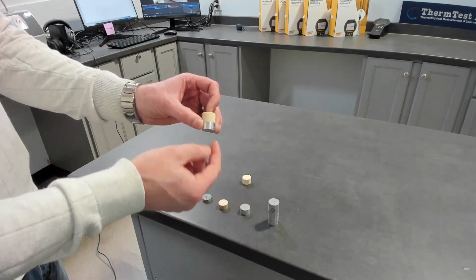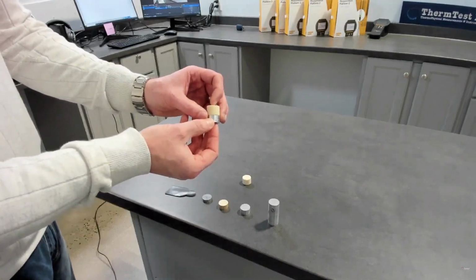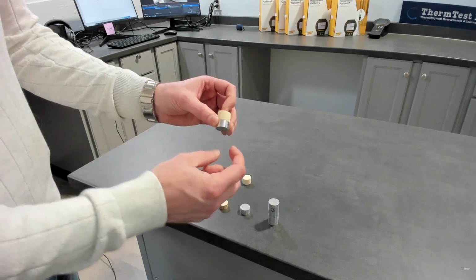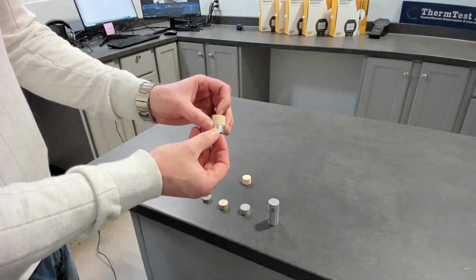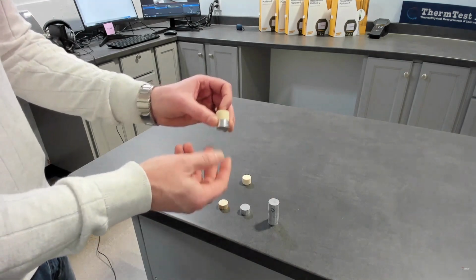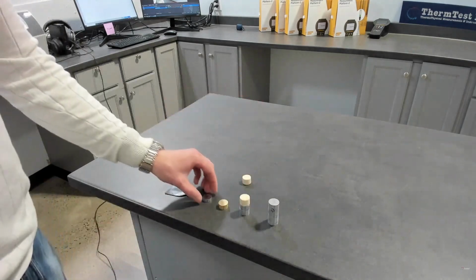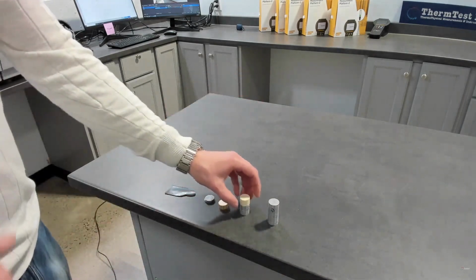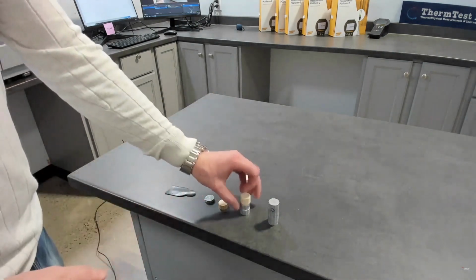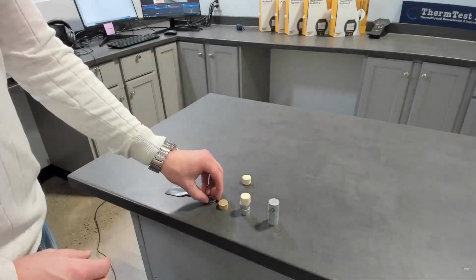So no longer do we need to input the specific heat. Even better, with one measurement with this module, which is called one-dimensional slab or 1D slab, you get thermal conductivity, thermal diffusivity, and specific heat. So you don't have to do a secondary measurement first. You just measure directly. There are other advantages to that. One is that now that we have boundary effects, we input the thickness, we can measure materials of higher conductivity or even lower conductivity at a much smaller height.